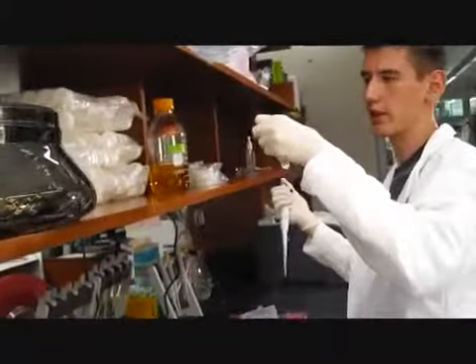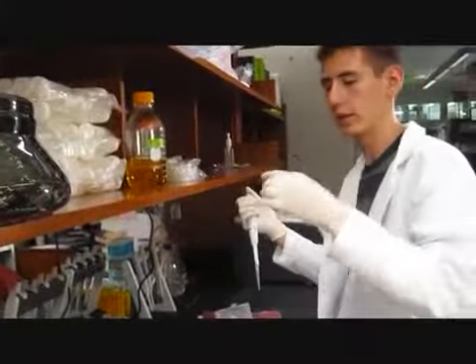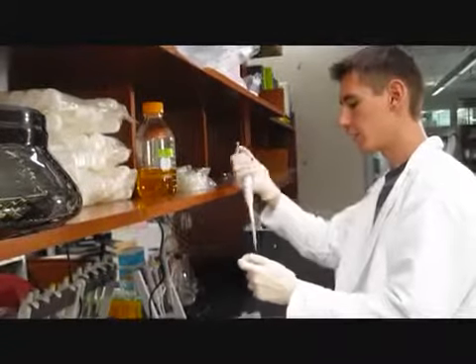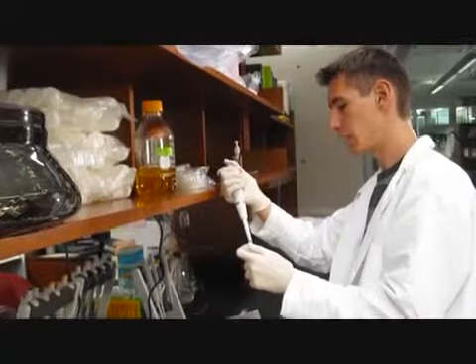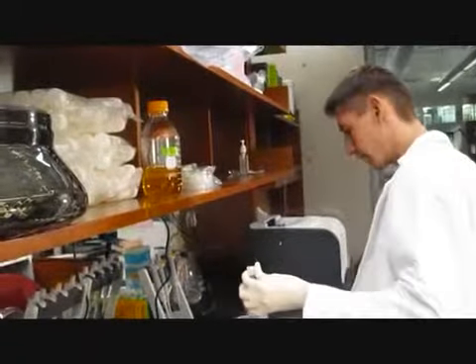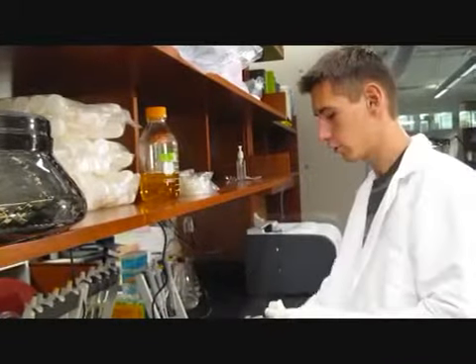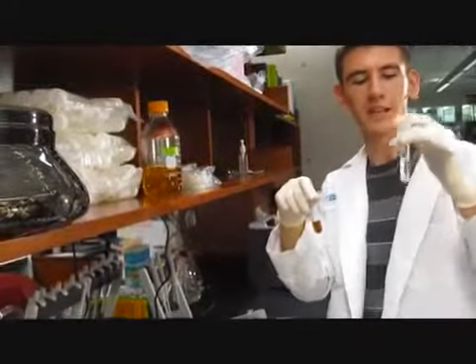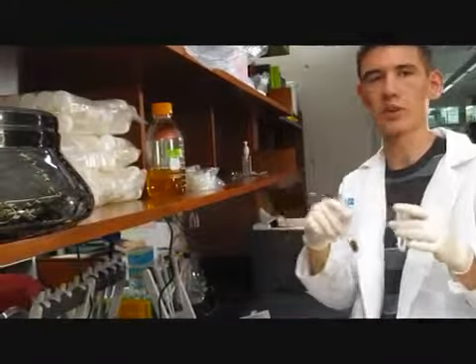Last one, this is H2O, sugar, HCl. Like I said, this is an important one because it's supposed to mimic the Coca-Cola, because that's what inspired this experiment. And if this has a varying degree of bacteria compared to the Coca-Cola, then obviously there's something in the Coca-Cola that's not in this simple solution that's causing that difference.